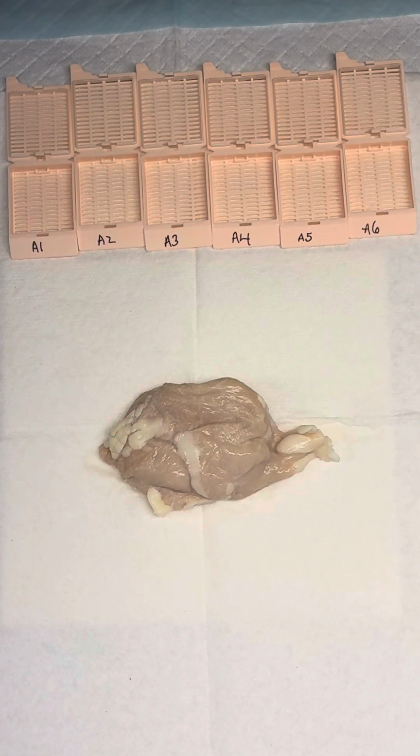I'm going to go over your thymectomy prosection today. So there's a couple reasons why you would receive a thymectomy in the gross room, right? We know our main reason is that it's an incidental situation. A patient goes in for open heart surgery and it's kind of in the way, or we get into our pathologic reasons why we might have a thymectomy. Those would be our thymomas or our thymic carcinomas, or treatment purposes for other disease processes like myasthenia gravis.